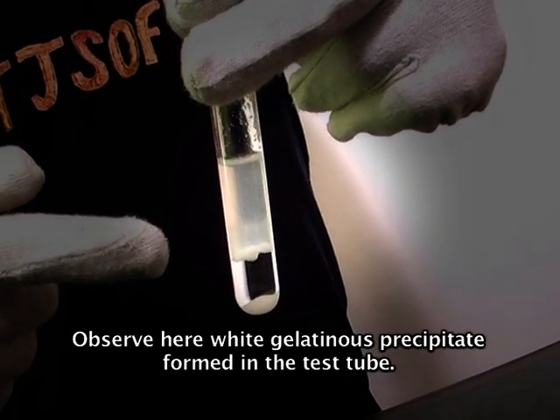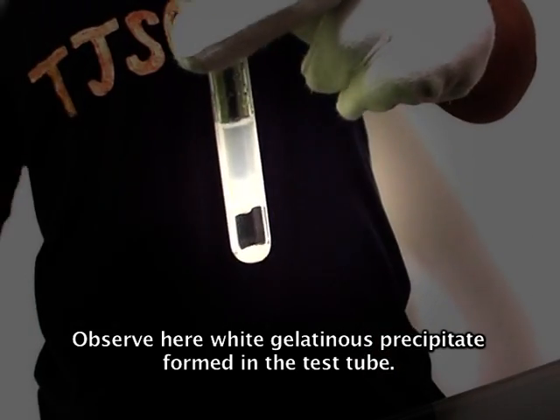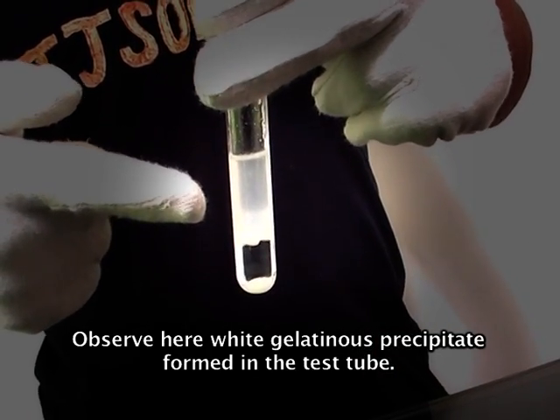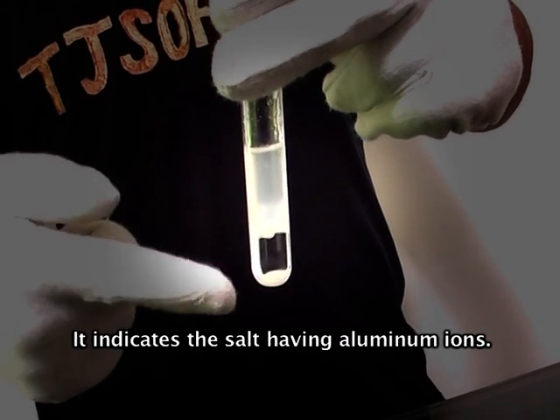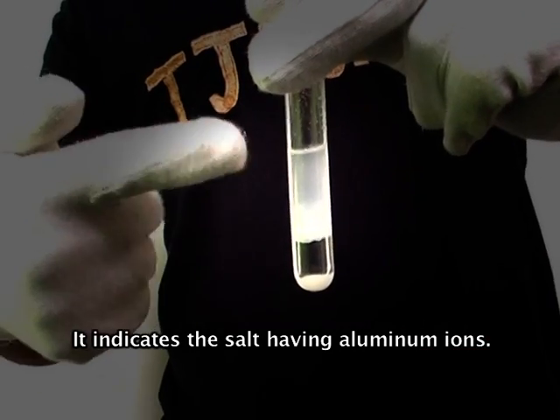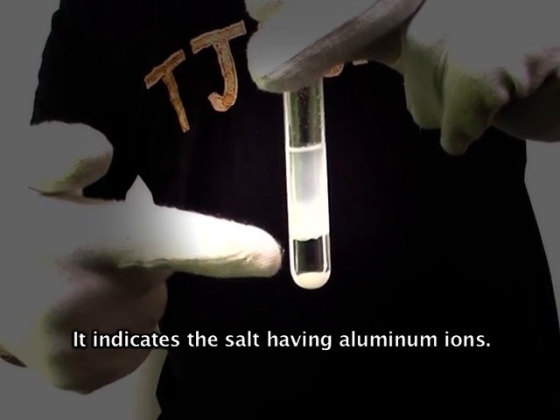Observe here — a white gelatinous precipitate formed in the test tube. It indicates the salt contains aluminum ions.